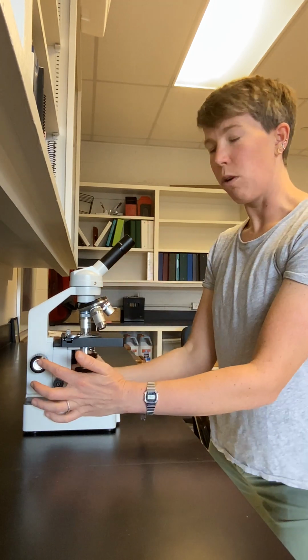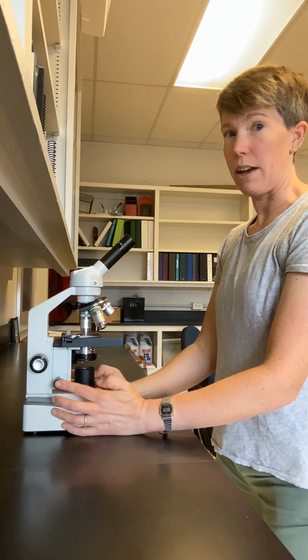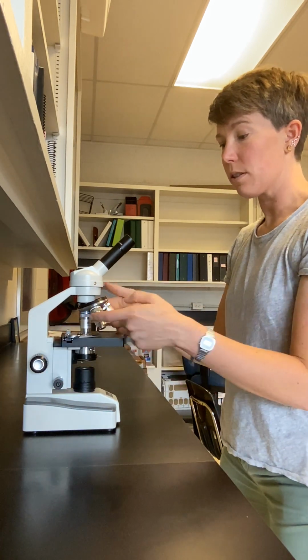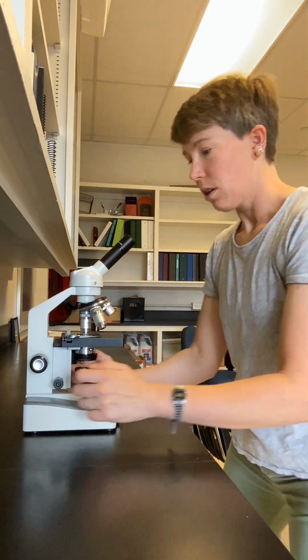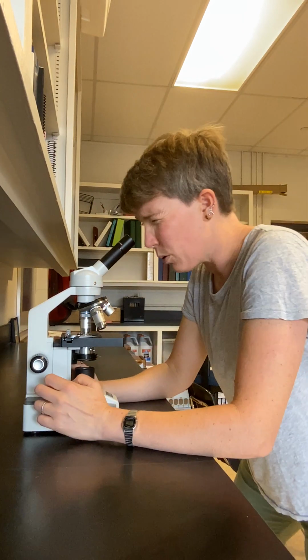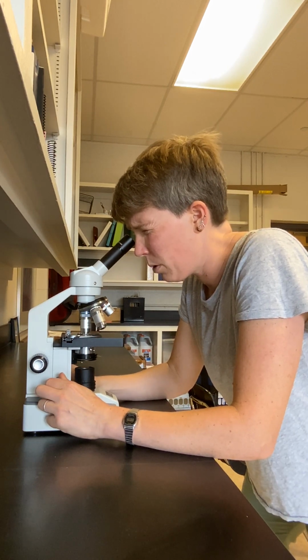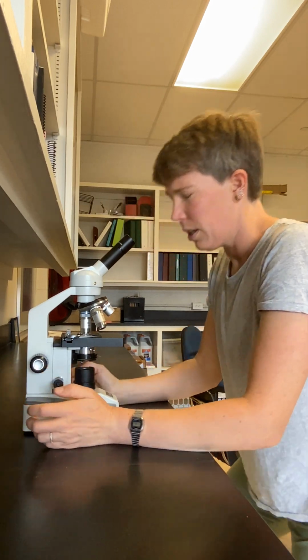Now, I switch from only using the coarse to only using the fine focus. I said objective, this is the focus knob. So I switch from using the coarse to the fine. You are not allowed to use the coarse focus with the high-powered objective lens, the 40x objective. So once you swing this back over, you are going to refocus only using the fine focus now. And now my sample is focused, and I'm going to recenter it in the field of view, and voila.